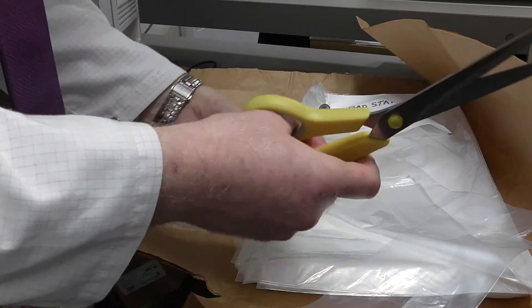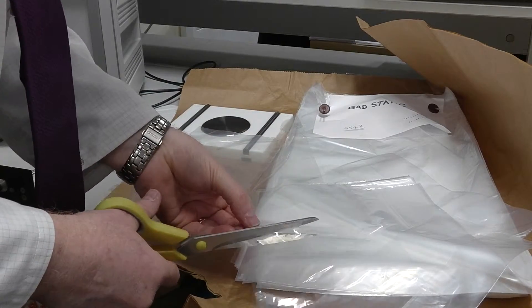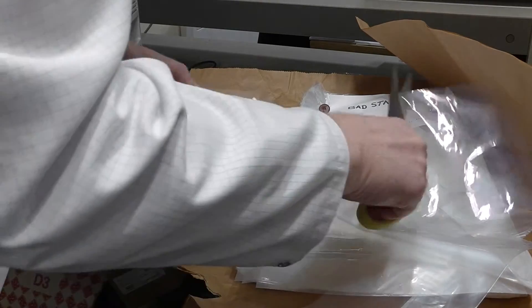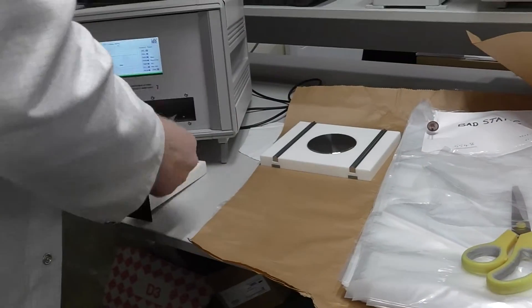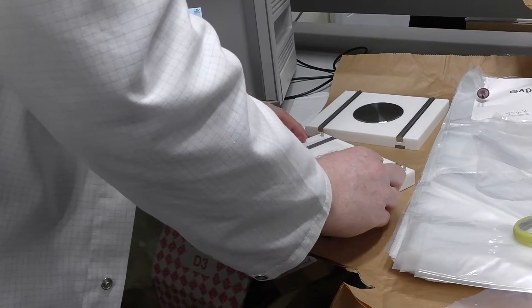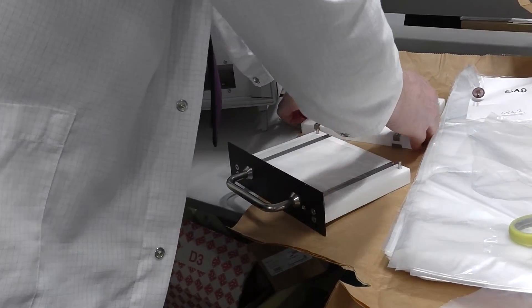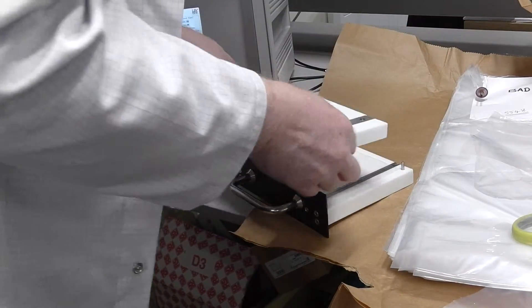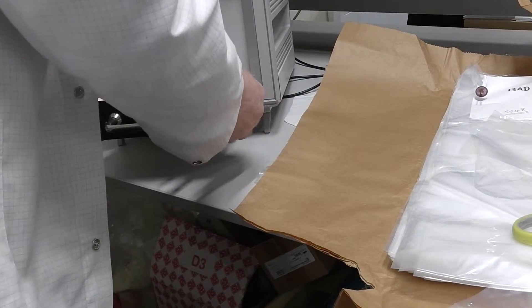So that's the last sample going up there. Just cut this roughly in half. We load the sample between the two carbon bars, place the top of the sample holder, and load the whole lot back into the instrument.